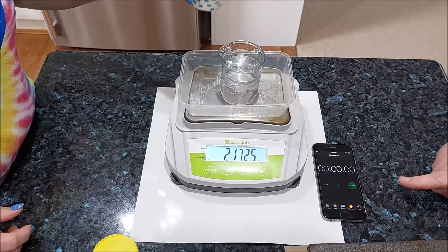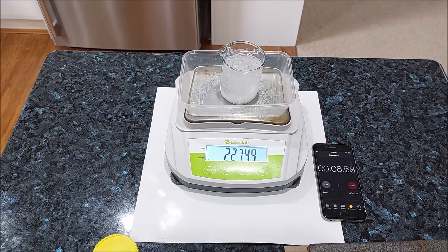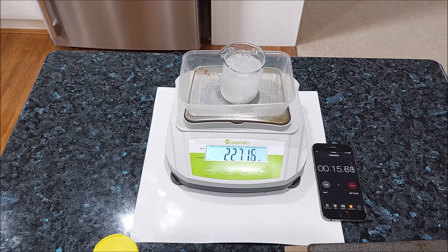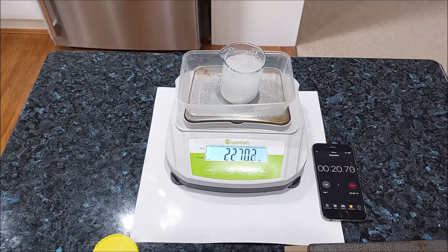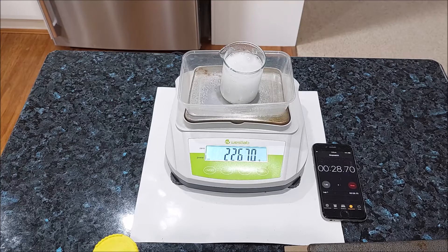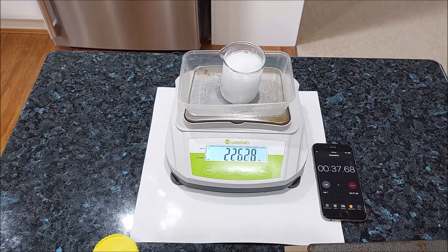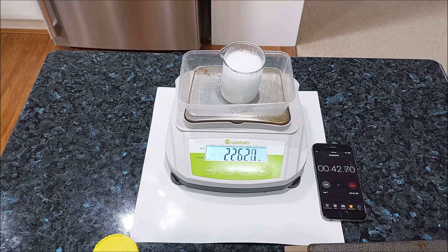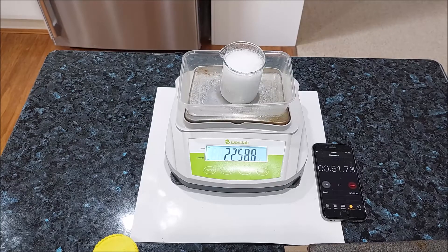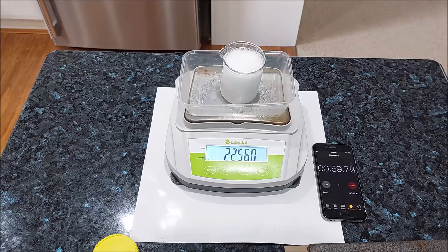And we are ready. Set, go. Getting ready for our first balance reading. 3, 2, 1 — 225.60.